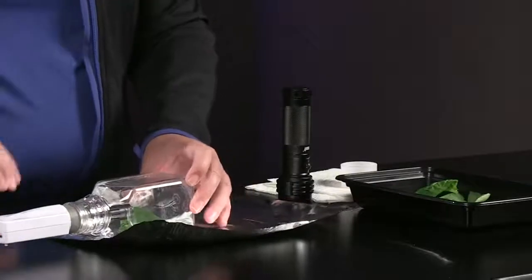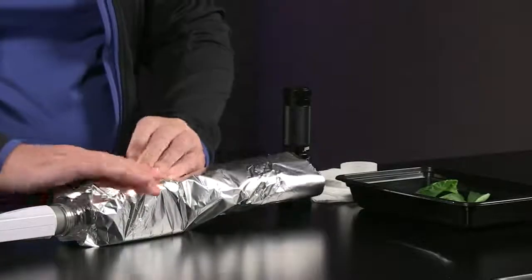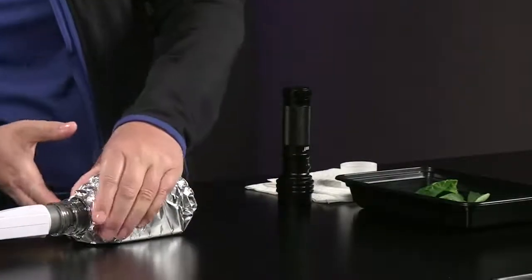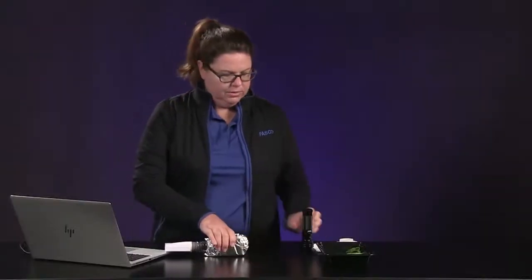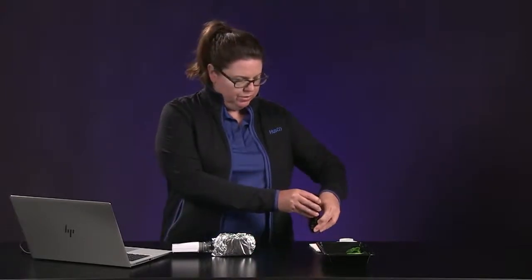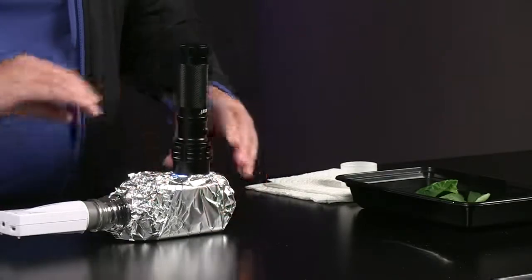Okay, now we will move to part 2 and investigate how leaves behave in darkness. We want to keep the system closed, but now I'm going to wrap the bottle up in the aluminum foil that we had. Got a good seal there. And then, since the only thing we're changing now is putting the leaf in darkness, I'm going to keep my light up on the top just to control that. All right, I'm going to let the system rest this way for about a minute.